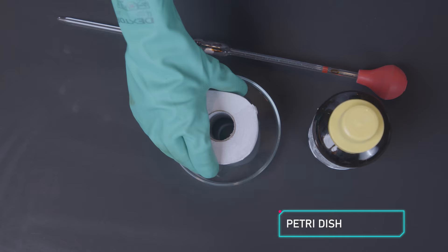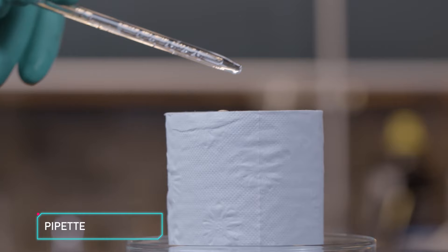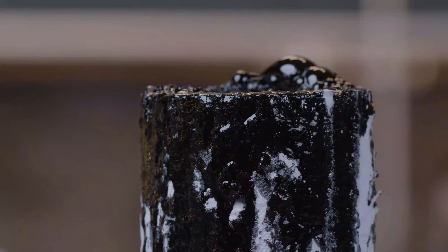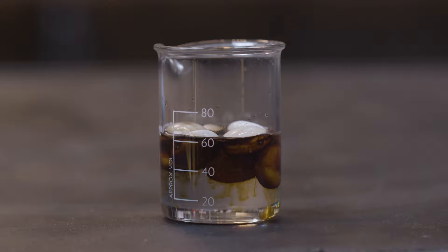Moving on, take a tissue paper roll in a petri dish and with a pipette, add some sulfuric acid onto the tissue roll. This acid is all about mass destruction, huh? Well, the once clean white tissue is now a black bubbling lump. This is the kind of stuff that gets me so excited.